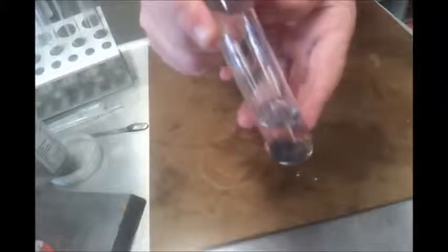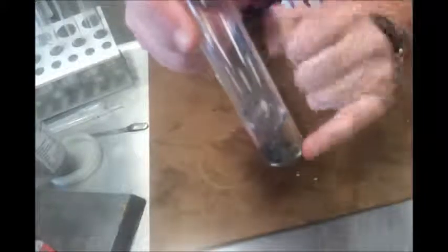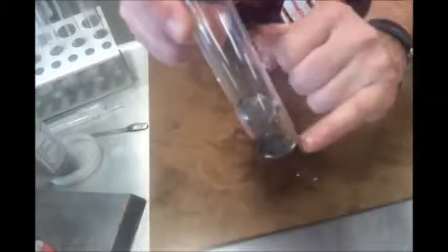I'm going to leave that for a while just to confirm that it is going to react. We can possibly in the video see a few bubbles forming down here. While we wait, though, I'm going to set up the next one. My next experiment is going to be looking at a chemical called iron 2 sulfate. So iron ions can exist in two forms, either iron 2+ or iron 3+. This is iron 2+, and it's a very, very pale green.